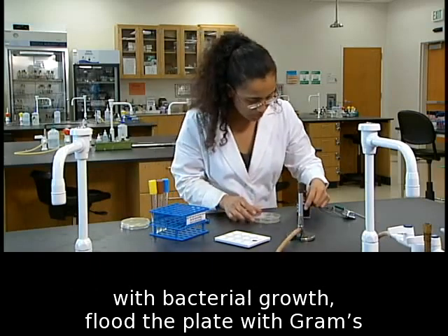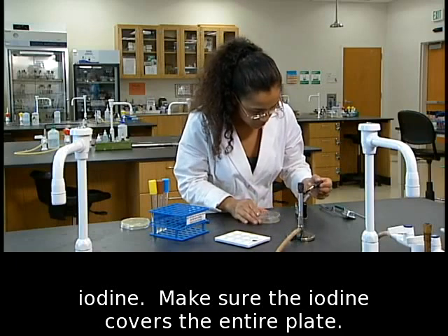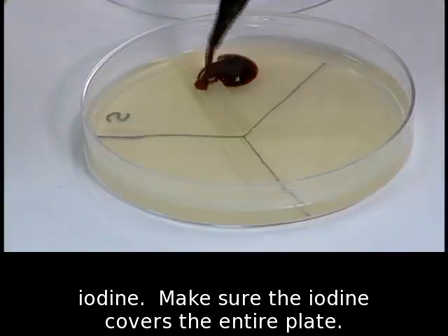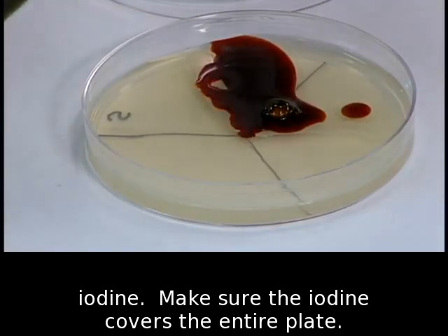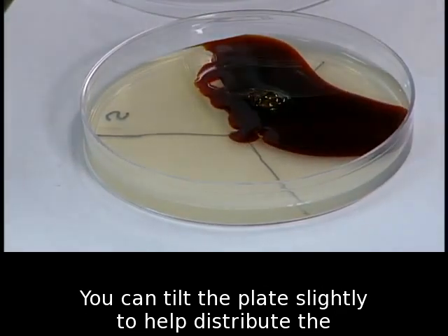Using the plate with bacterial growth, flood the plate with Gram's iodine. Make sure the iodine covers the entire plate. You can tilt the plate slightly to help distribute the iodine.